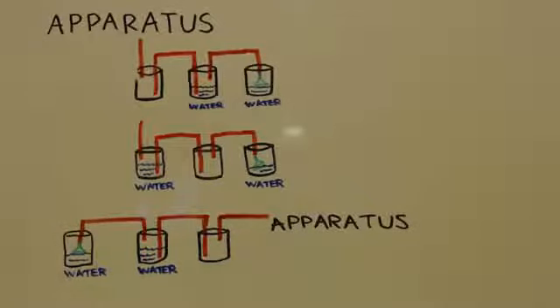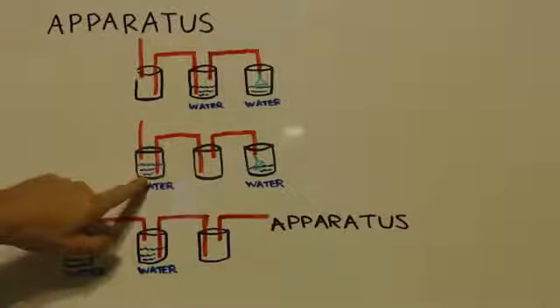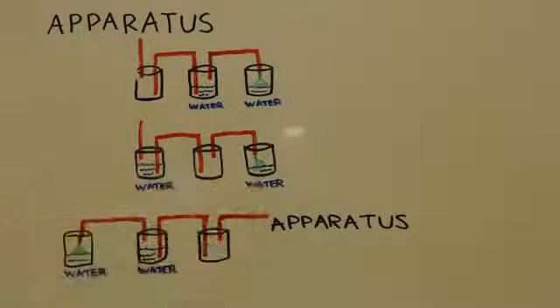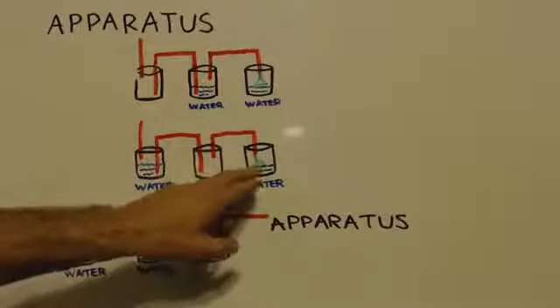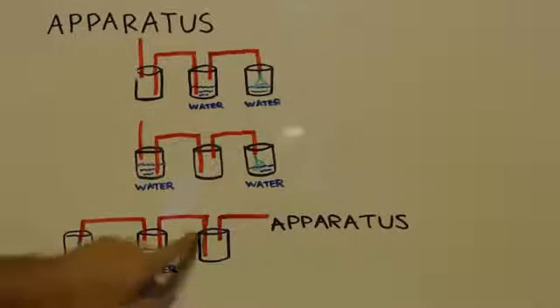Now I want you to think about this. Let's say that a suckback does happen. This is the second part. The water gets sucked up. Now you've got water here, and you still have water there because it can't actually get sucked up. What you can do now with your bubbler is pull this funnel off, and you can see this setup right here. It's set up the same. The hoses are the same exact way.